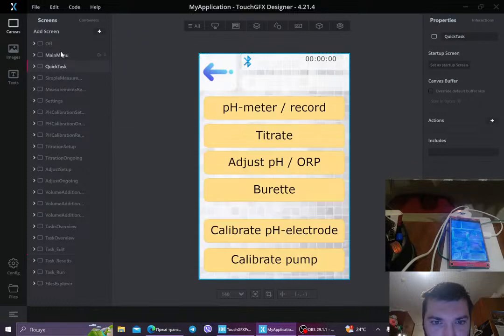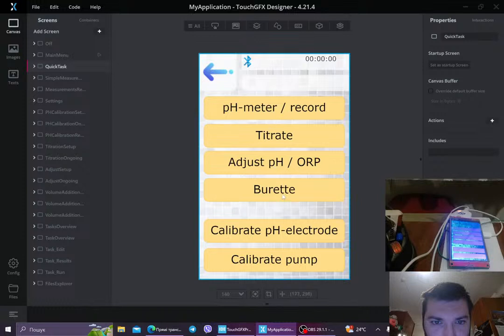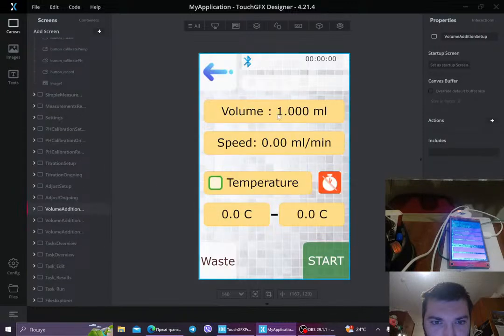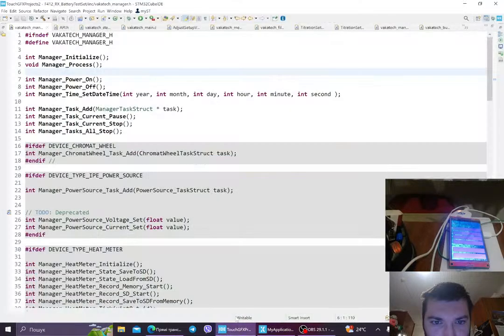This actually here. So from the main menu, this is the main menu, we go to the quick task. You see it right here. We go to the quick task menu, and let's say we go to burette. I'm gonna go here, and then we can select the temperature, show how much, what is the range, and the titrator will add the specified volume at the specified speed, but once it reaches the temperature, it will stop and it won't proceed any further. So let's go back.